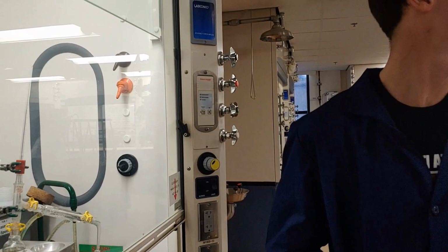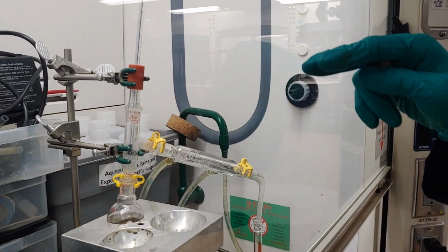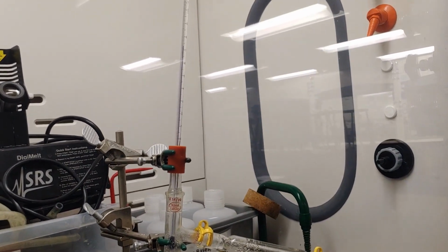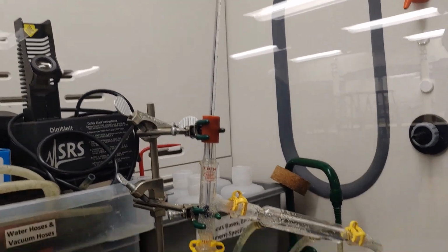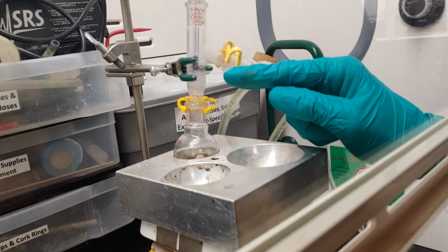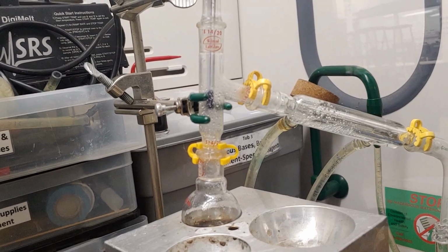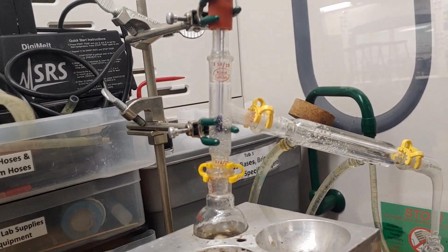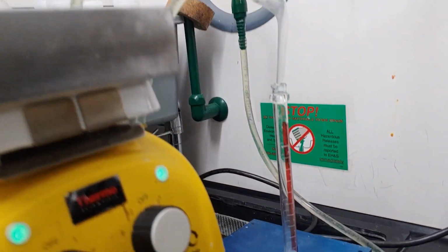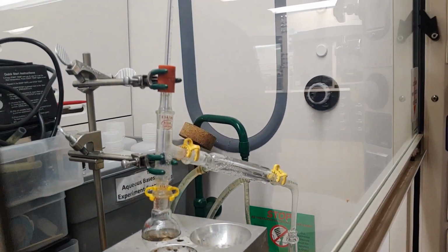So at this point, it's been about 25 minutes in the reaction, and in the last minute, it's jumped from about 23 degrees to almost 75 degrees. So I do expect that it will be distilling here shortly. We can see a little bit of condensation forming in that Y adapter, so that's a pretty good indicator that it should be distilling shortly if it has not already. So I will be back and let you know how long it was before it started distilling.